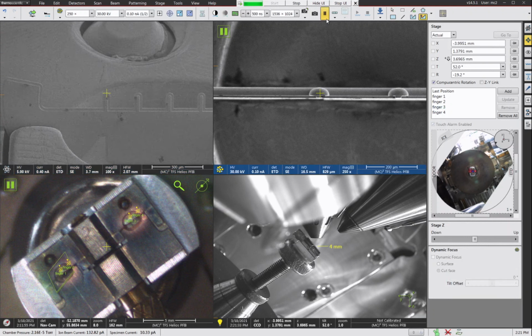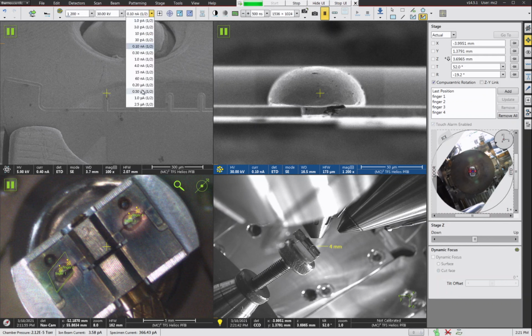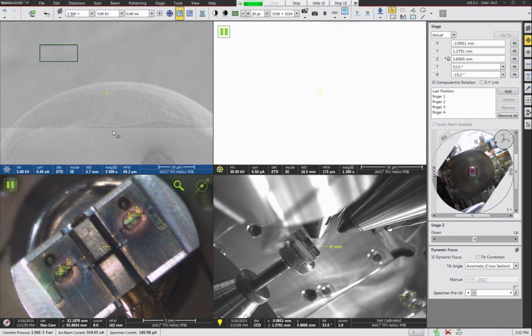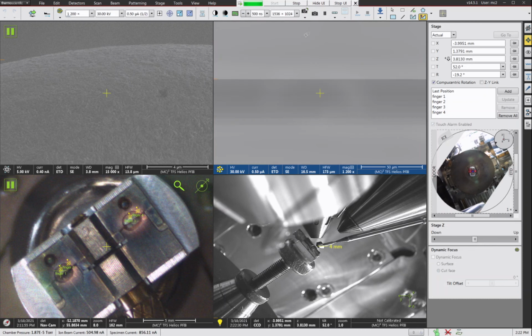Right. So the first step of the procedure is we're going to do a coarse cut to try to shape this thing into a rough post. I'm going to do this cut at a 0.50 microamp beam current. And when you image with this beam current, well, if I had my working distance linked correctly, the shutter would go in. Let me redo that. There we go. So there goes the retractable shutter to protect the SEM column from the sputtered material off of the grid.